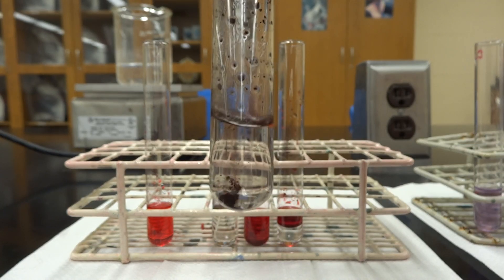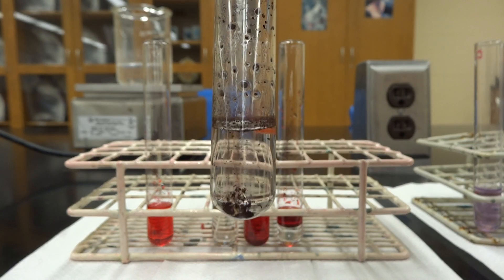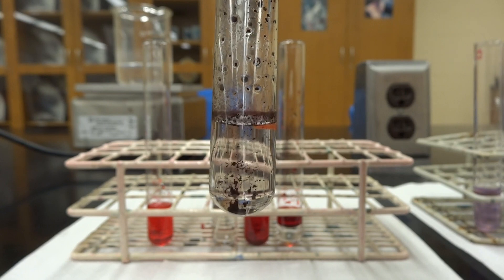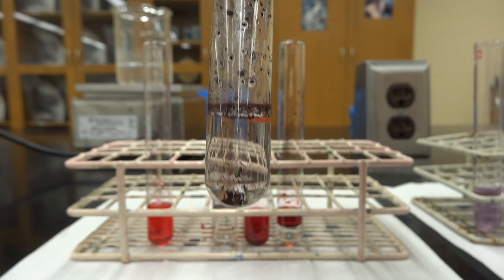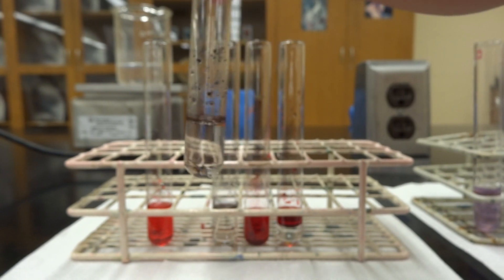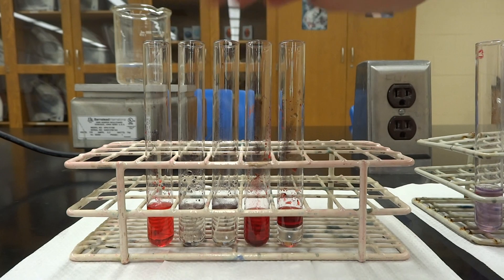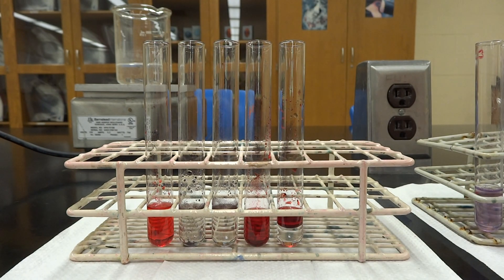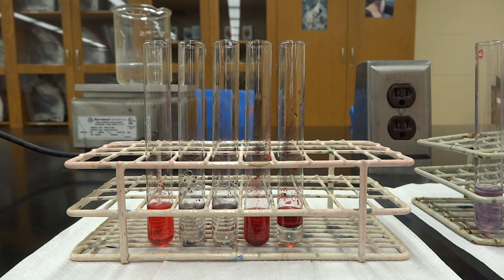You can see that the powder is just kind of swirling around in the water — it clearly didn't dissolve, which makes sense, because since Sudan IV is a non-polar substance, it can't dissolve into our polar water.